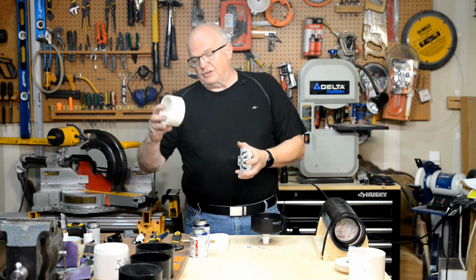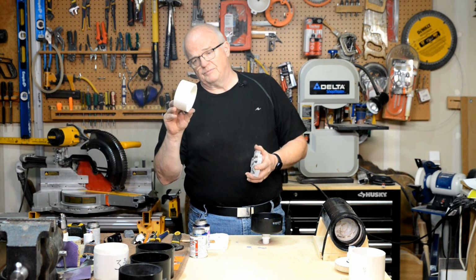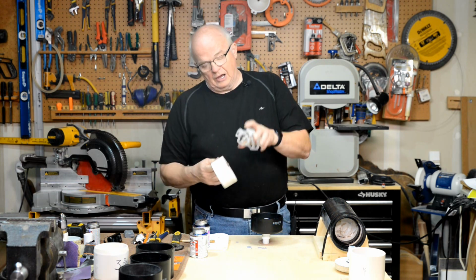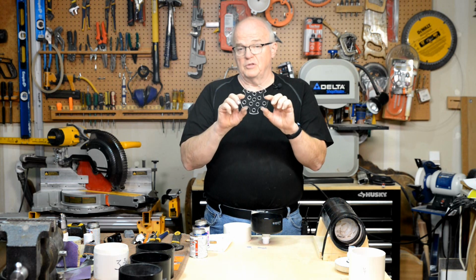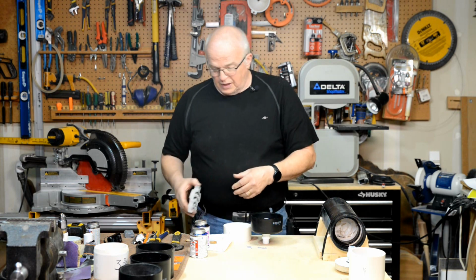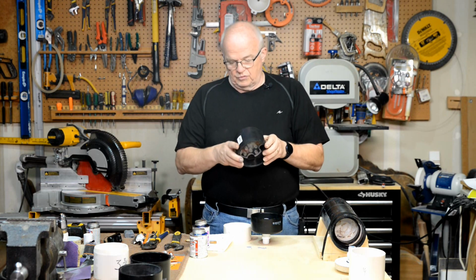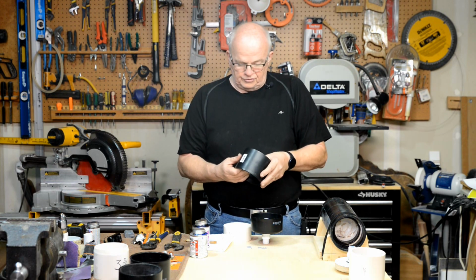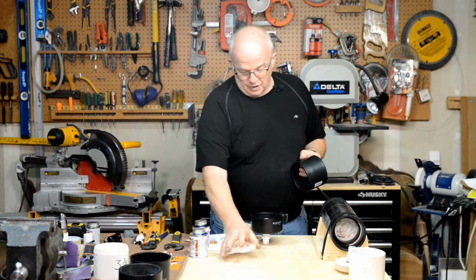The next step is to take that 2 1/4 inch piece of pipe and your strainer. This piece you should have made in the prefab. It should look just like this, and it should fit right down inside of one of these shoulders or the sleeves. And this does. It fits in there very well. So here's where we put on the first sleeve.